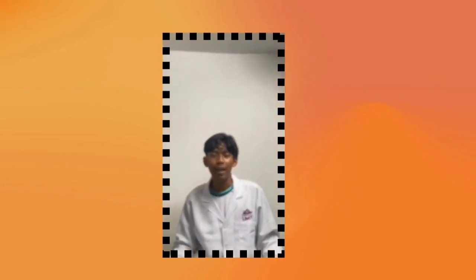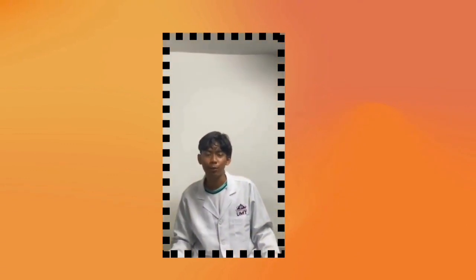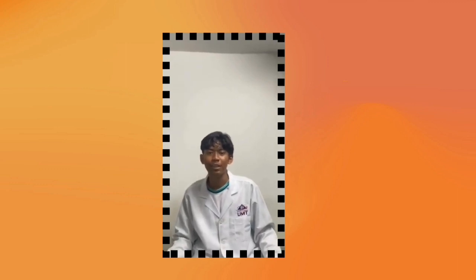Hi, my name is Adli Haziq, A2897, and today I'm going to chat about how a UV visible spectrometer works. So, first of all, UV visible spectrometry, also known as UV visible spectroscopy, is a technique used to measure the absorption of ultraviolet and visible light by molecules. It's a widely used method in chemistry, biochemistry, and physics.